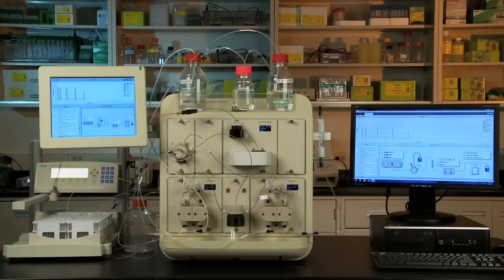Depending on your lab's setup, you may also want to create space for a fraction collector and operating computer next to your NGC.